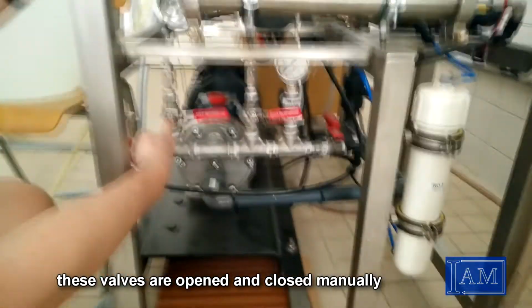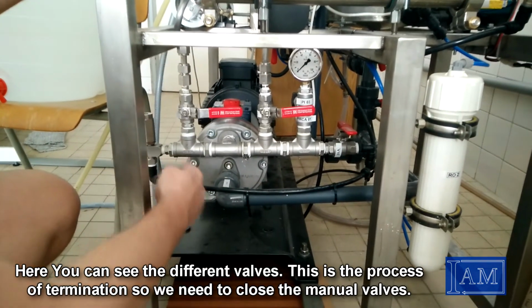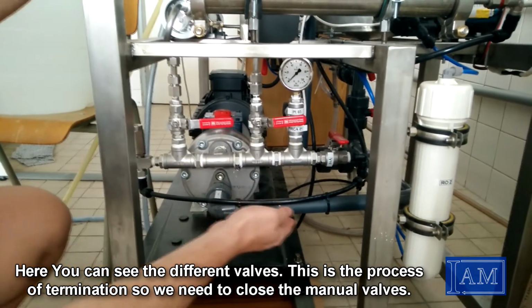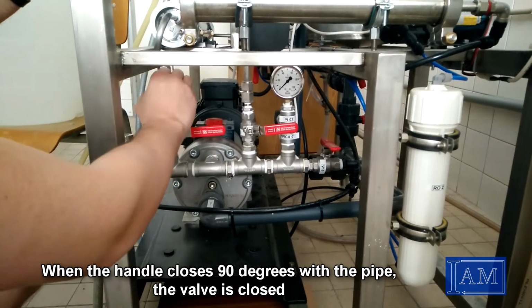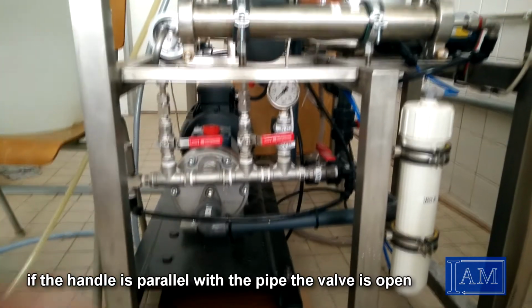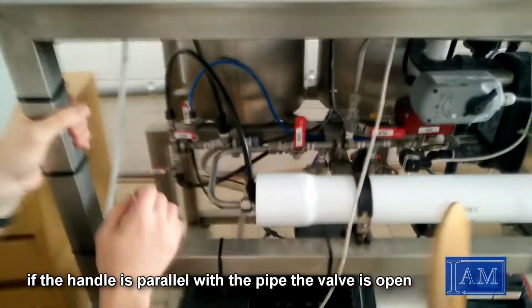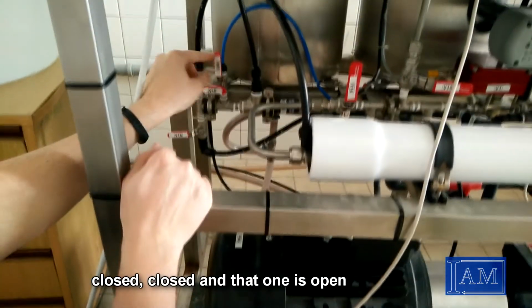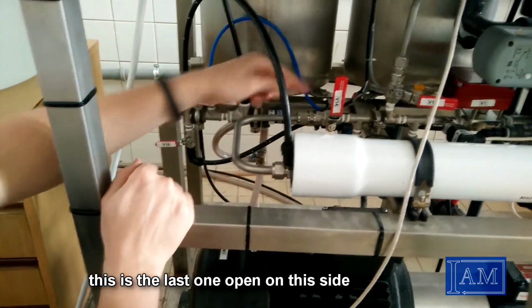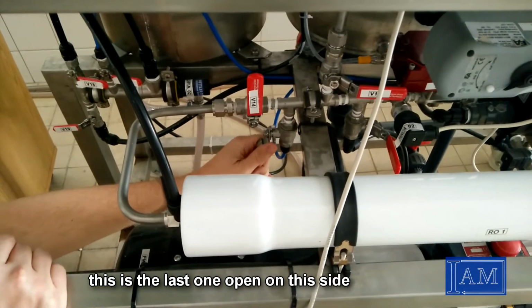Here you can see the different valves. This is the process of termination, so we need to close the manual valves. When the handle closes 90 degrees with the pipe, the valve is closed. If the handle is parallel with the pipe, the valve is open. Closed, closed, and that one is open. This is the last one, open on this side.